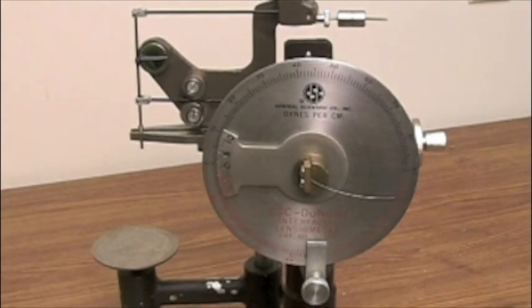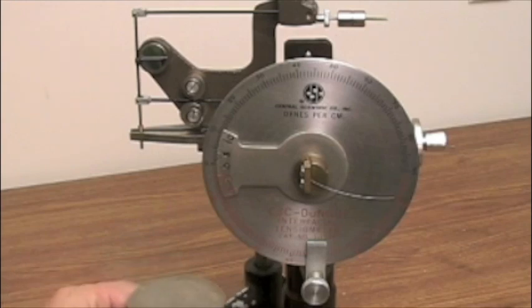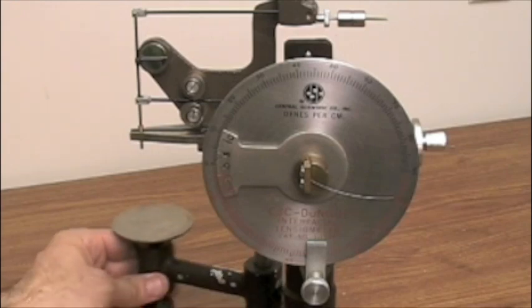Okay, one of the first things you want to do after you've taken your tensiometer out of the package or out of the box is you want to set it up. The first thing is you've got your platform here, your sample platform. You want to get that out of the way.